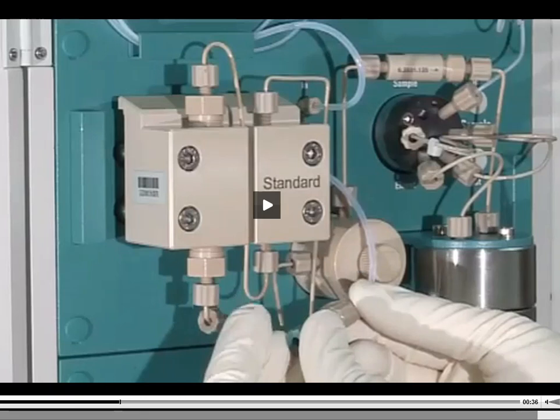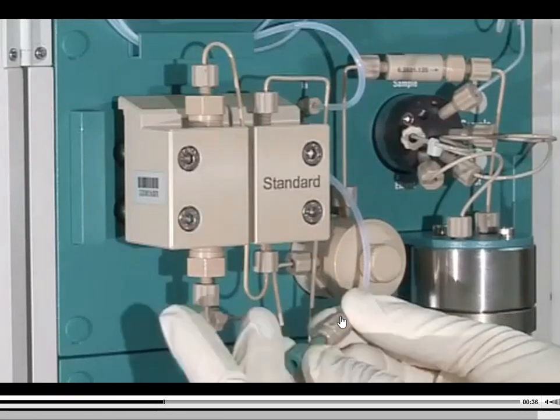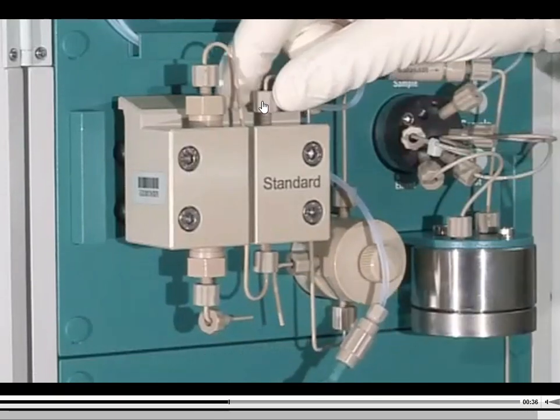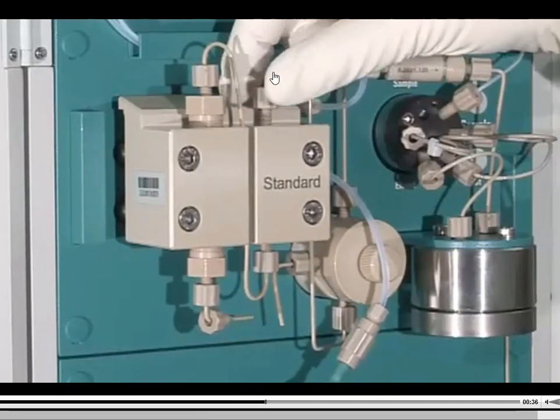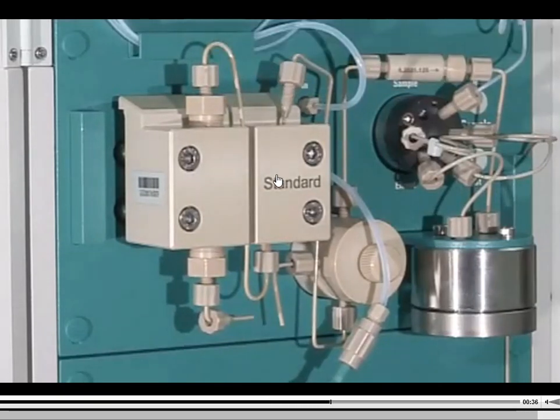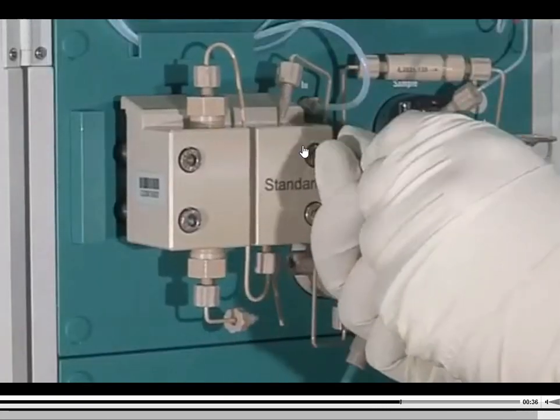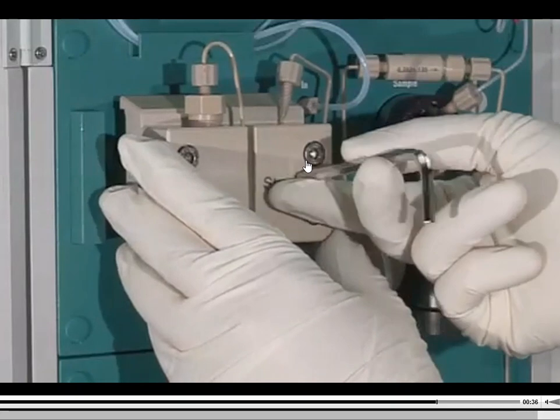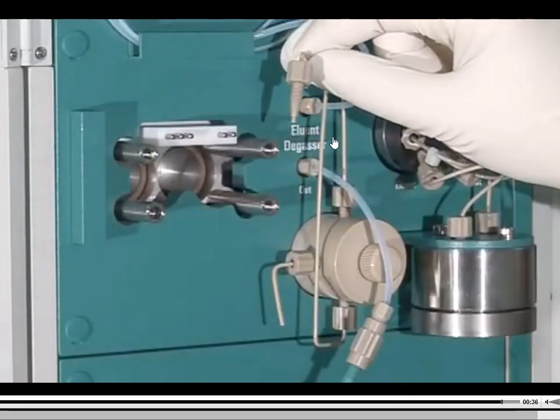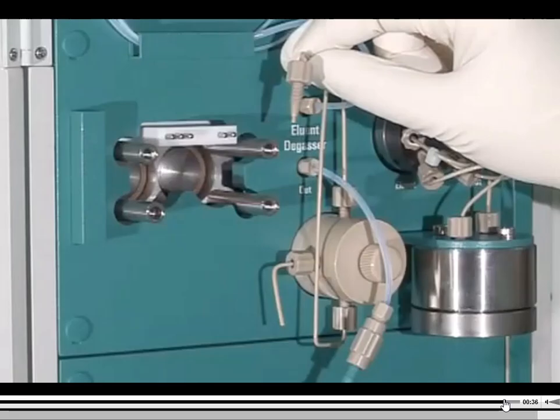So after that, you're going to see them basically unhook the pump from a different position. Up here at the very top, you're seeing that screw being taken off. And the reason is because these two pieces are constricting that pump. It's kind of locking it into place, and you need to loosen those if you're going to take the pump out. At this point, those screws are getting loosened up with an Allen wrench or a hex wrench. And then now you're seeing basically the internals of the pump here at the very end.